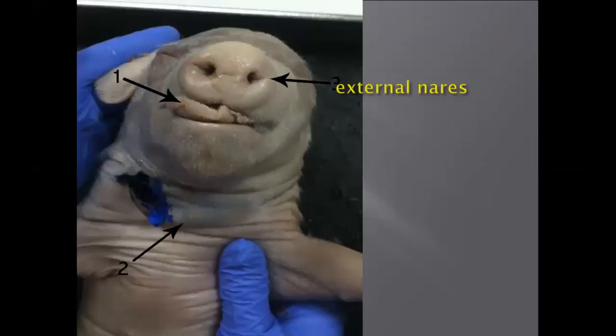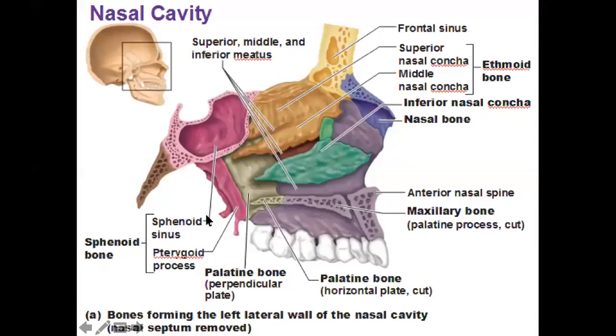All right, so moving on from that, we're going to see pictures from the pig, or may use a model, so the external nares or nares, however you want to pronounce it. Those are just the openings for the nose there. This one is on one of the practice quizzes, I believe. It's not a trick question. If I ask you for the structure inside the mouth there, that's the tongue. I'm not sure exactly what two is supposed to be pointing at there. Oh, well. It's probably something else I forgot to put on there.